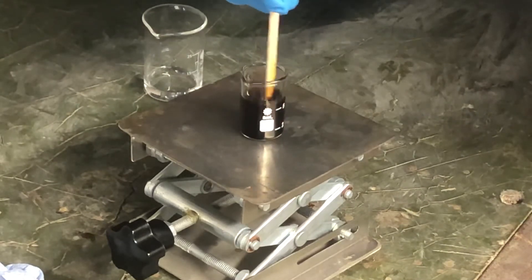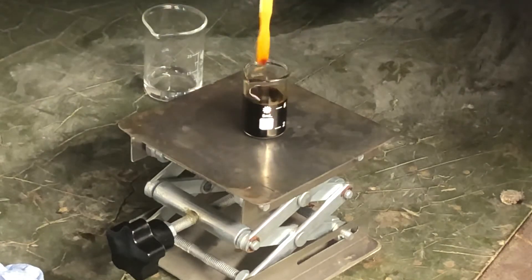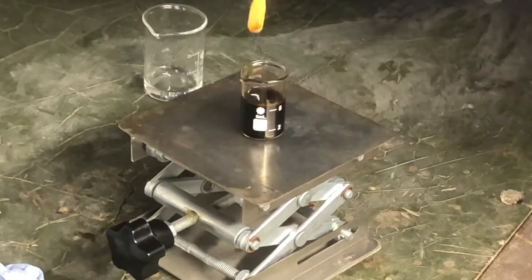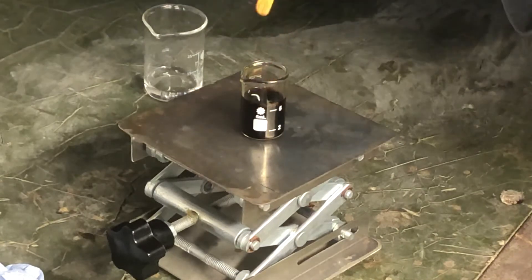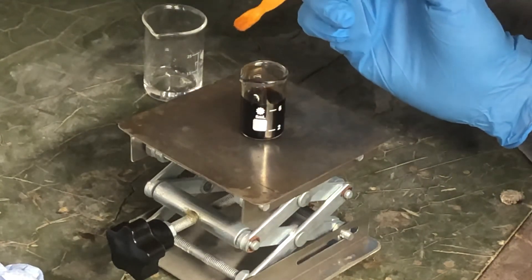So I'll give this a stir. And this is actually the reaction as it's done. I'm not entirely sure how fast it's supposed to be, but it seems to have almost stopped bubbling.